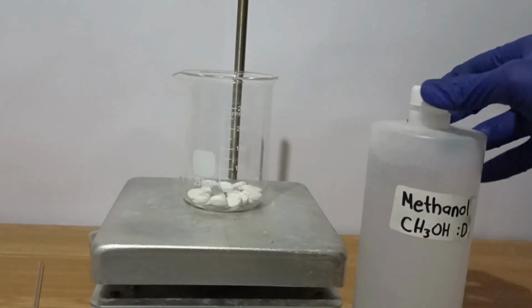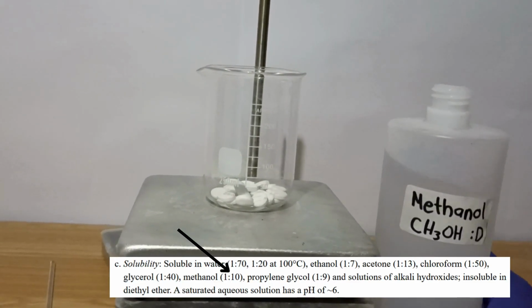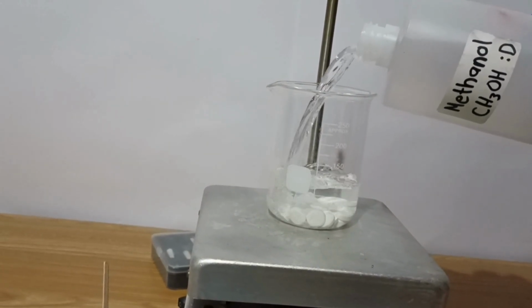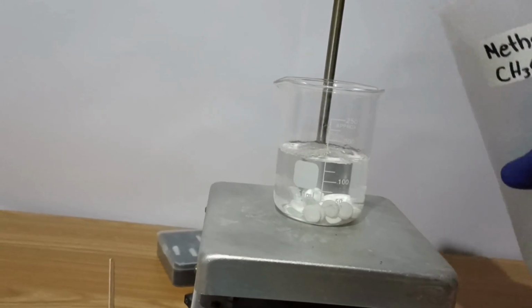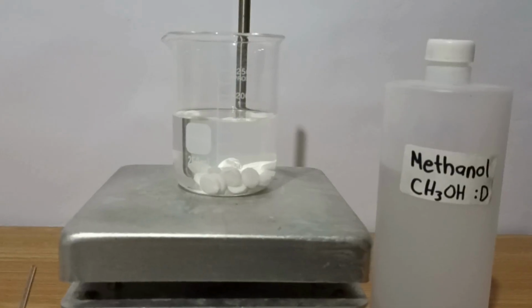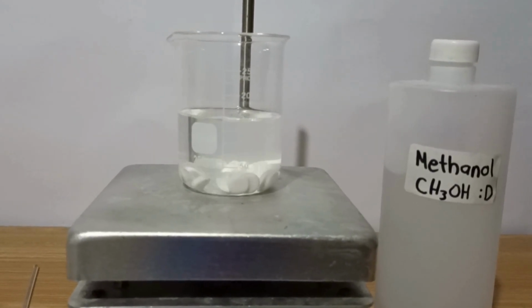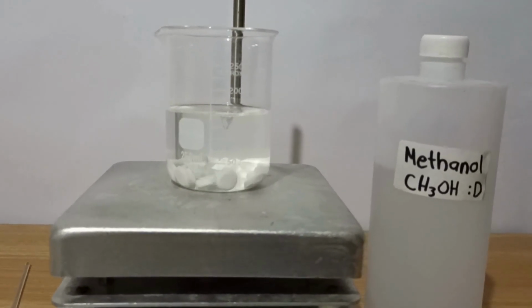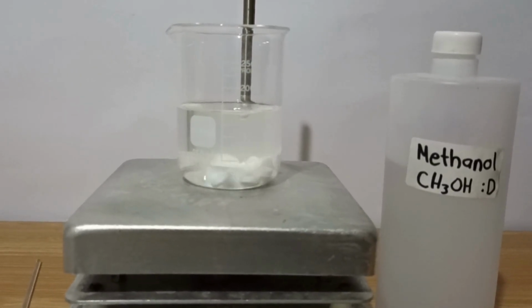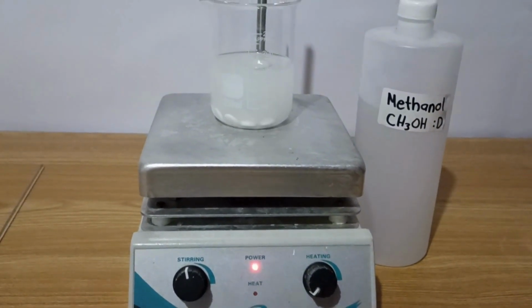According to a source, paracetamol is soluble in 1 to 10 parts of methanol. So I added 150 ml of methanol, representing excess, so all the paracetamol is extracted. Then I added a stir bar and started mixing. After some minutes, the tablets started dissolving.